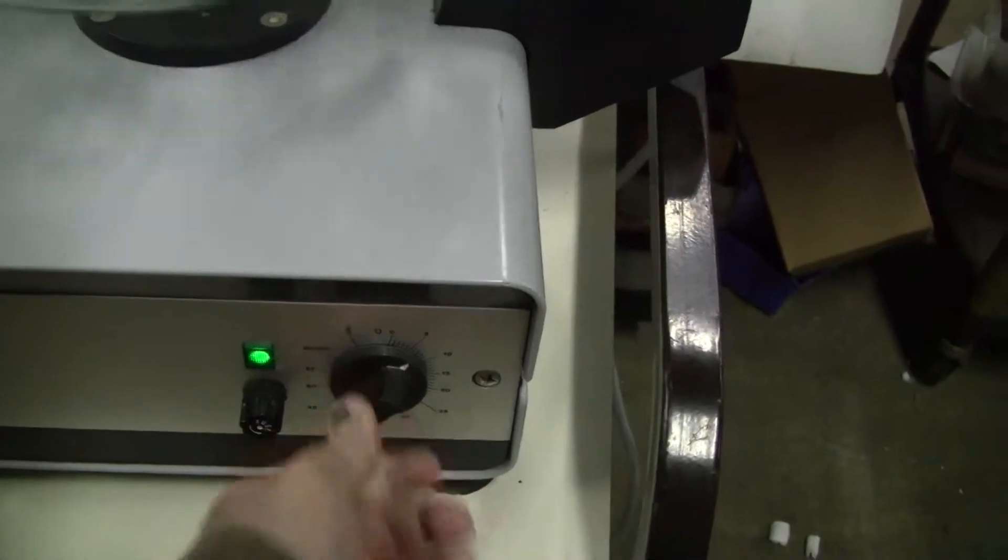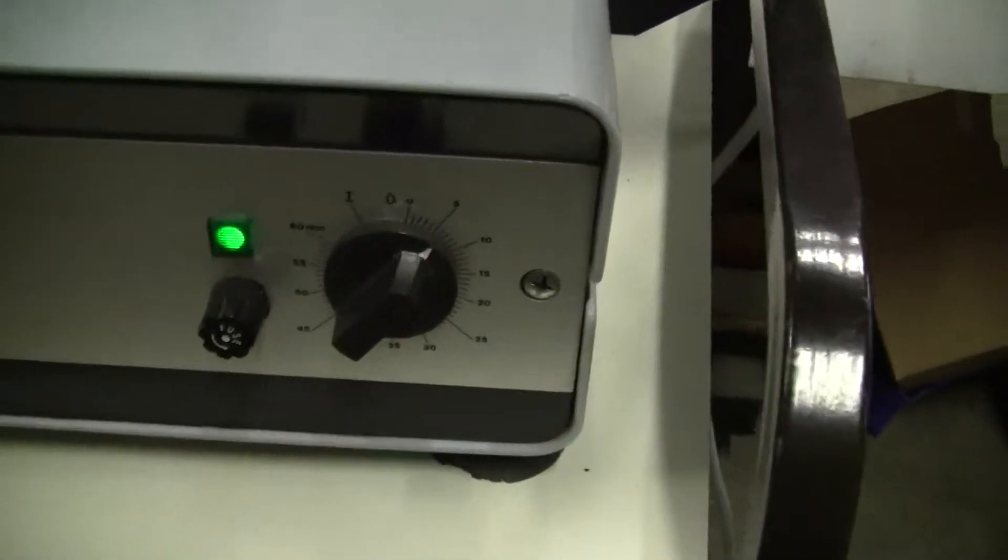Let's turn that on. It has a timer up to 60 minutes where you can run it continuously.